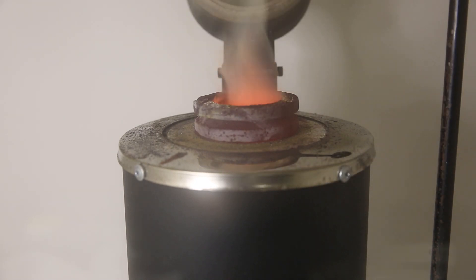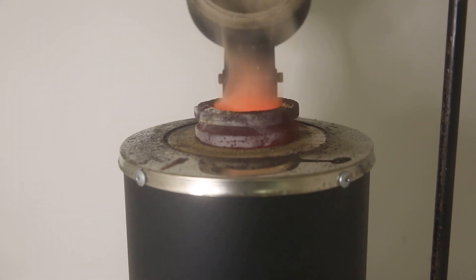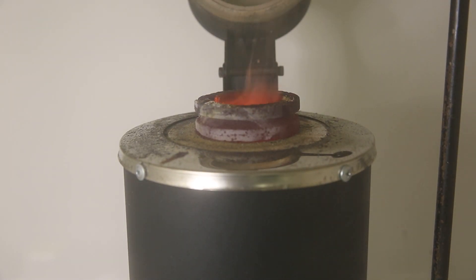Taking the silver chloride and spreading it out over a large surface and allowing it to degrade under light before putting it in the furnace might actually help by pre-converting a lot of the silver chloride to silver. This can decrease the amount of time needed inside of the furnace.